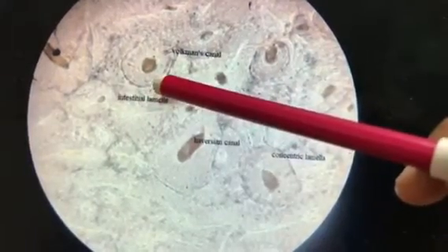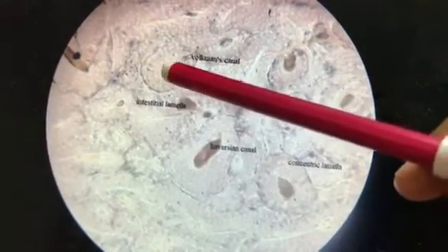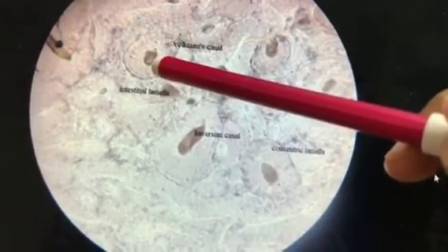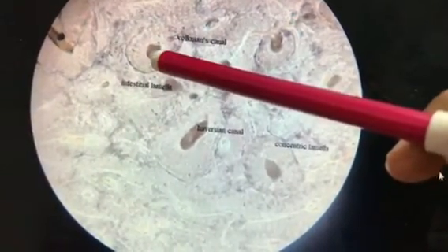What does this osteon contain? And what are these? We'll ask. Number one: can you see the central canal? This is the Haversian canal. What does the Haversian canal contain? That is the first question. It contains one or two capillaries, and myelinated and non-myelinated nerve fibers will be here.